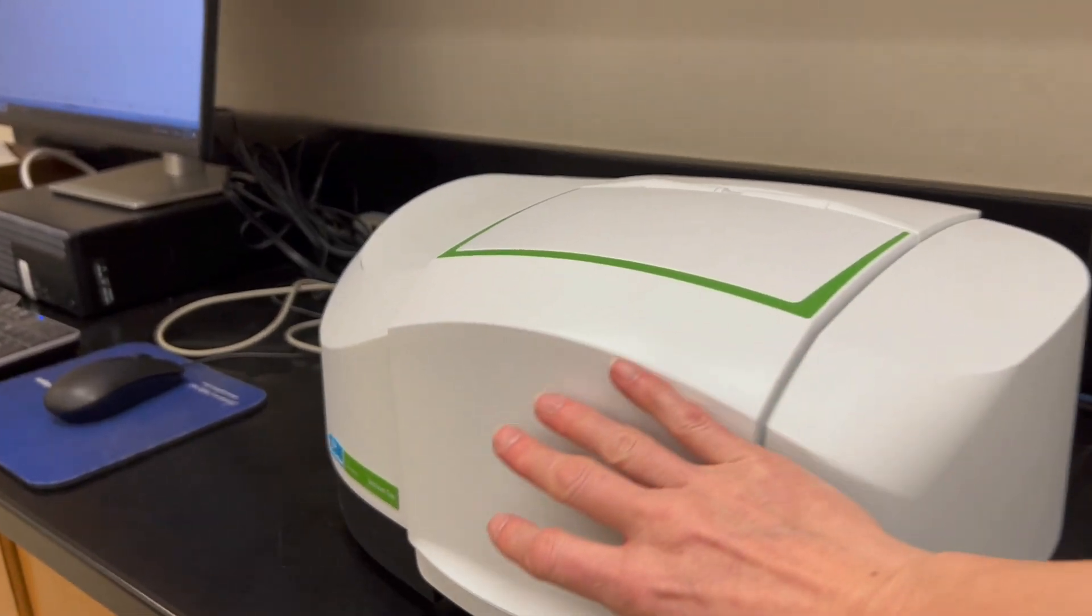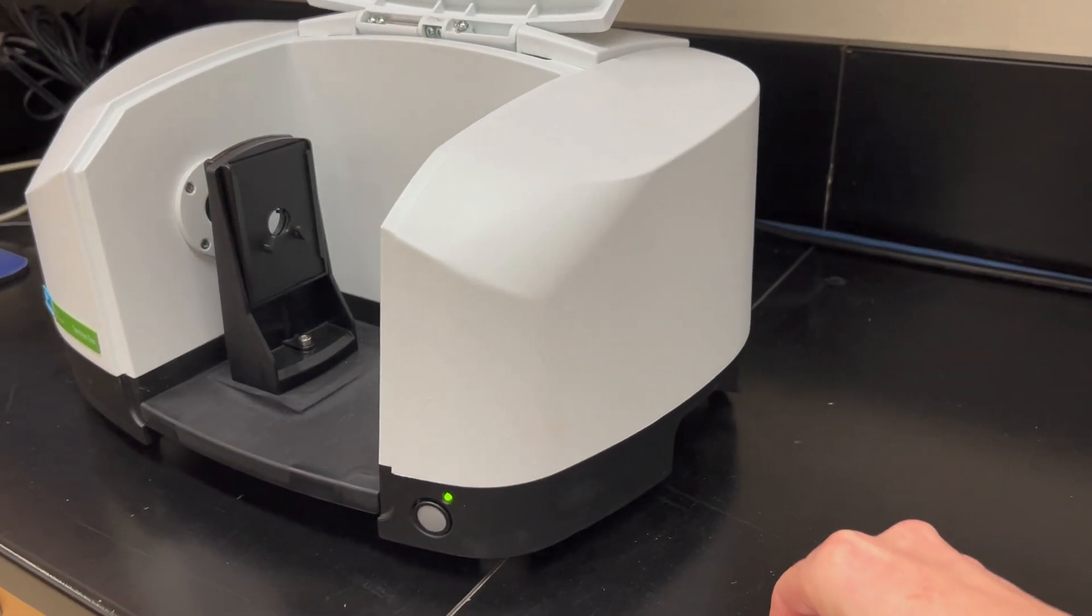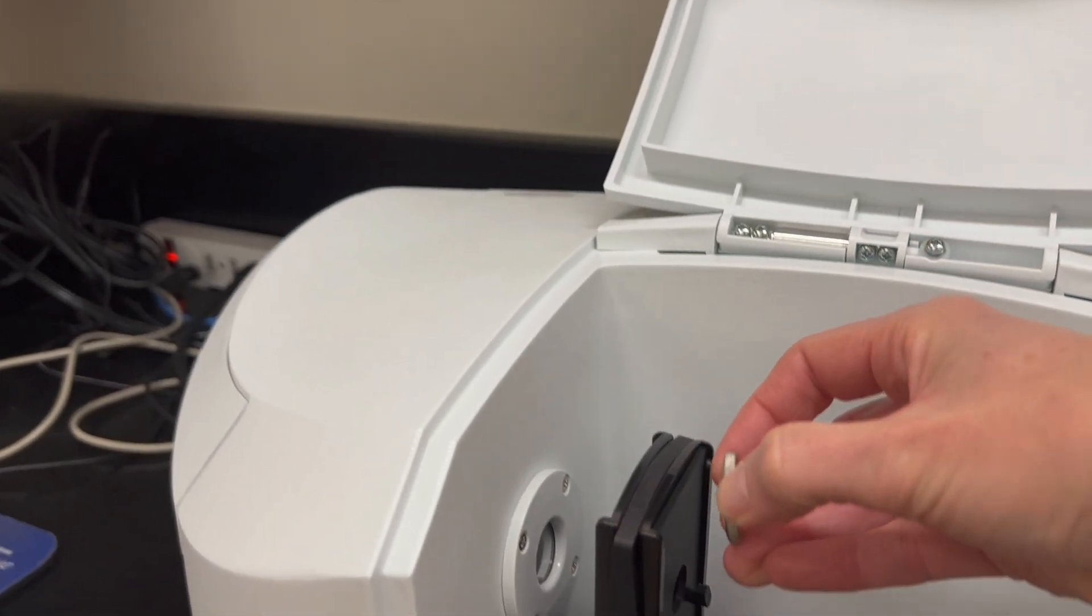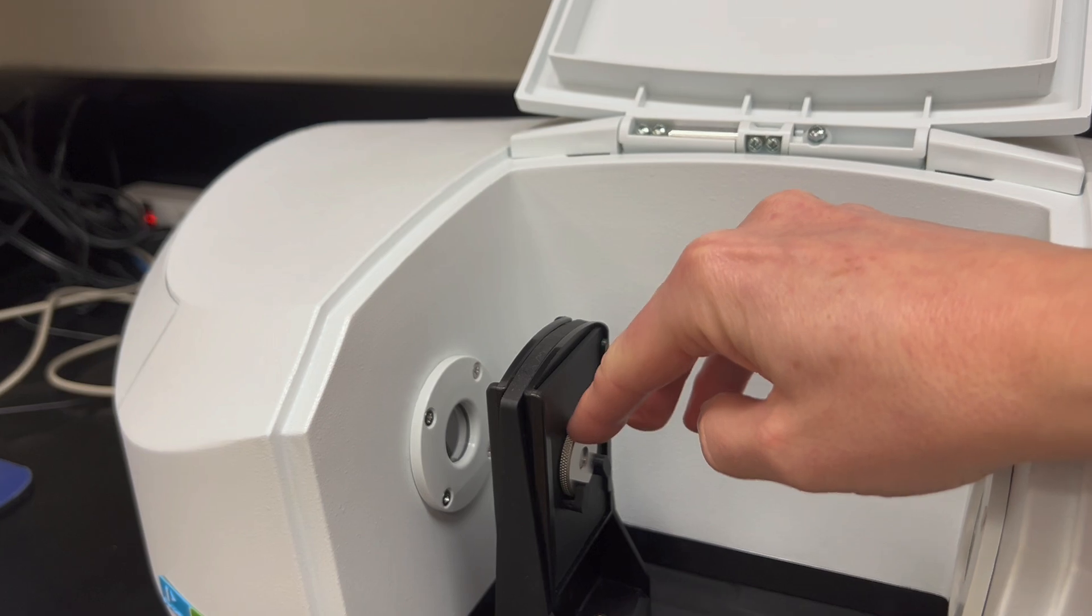Then at the IR instrument, you can open the flap, and we have holders that are designed to hold onto that little middle piece perfectly, so just put that in the machine and run the IR as normal.